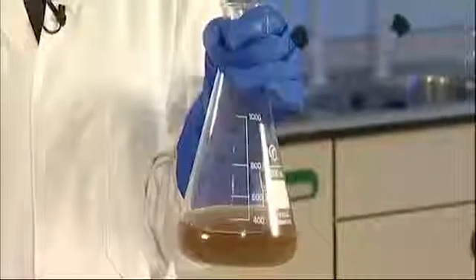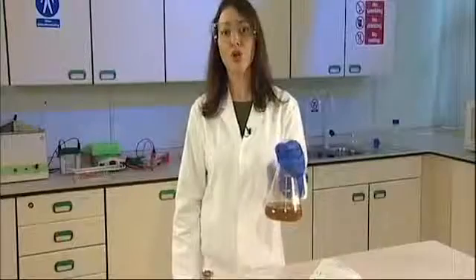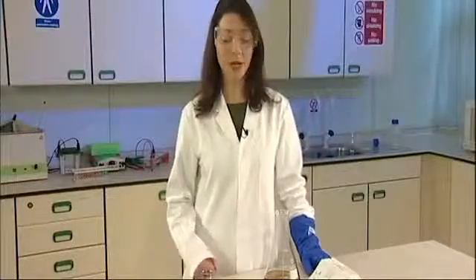First we need to pour the 16 LB agar plates. You can pour the agar while it's still very hot, and that will help reduce any airborne contamination. Before you begin, you need to flip the plates over so that they're the right way up.